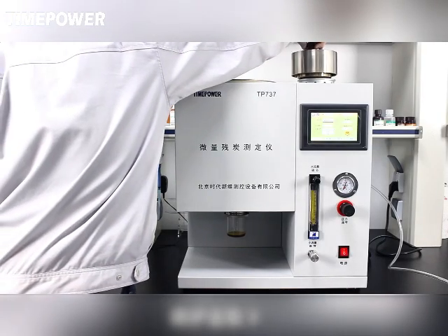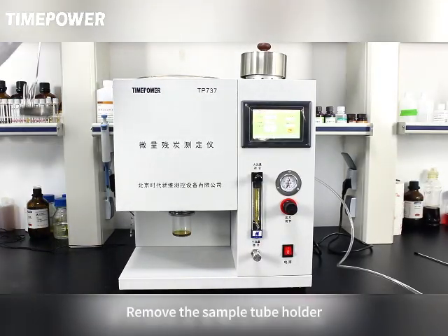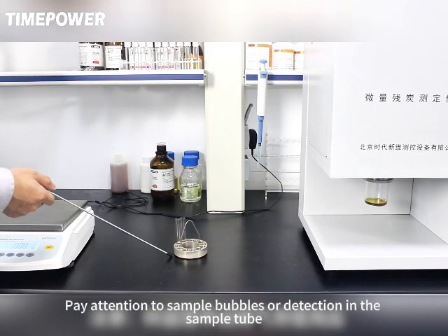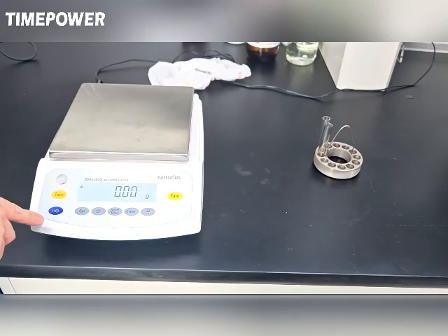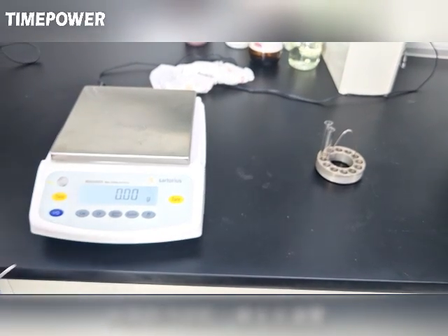Remove the lid. Use the bracket to lift out the sample tube holder to cool. Pay attention to sample bubbling or splashing in the sample tube, which causes sample loss. The specimen should be invalidated and the test redone.